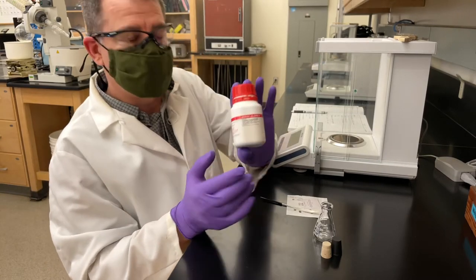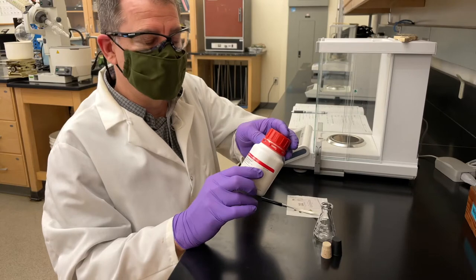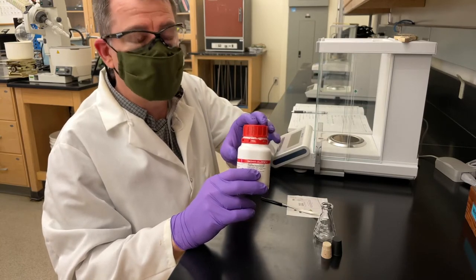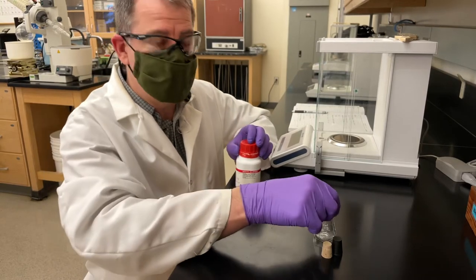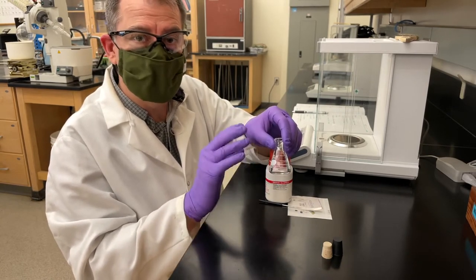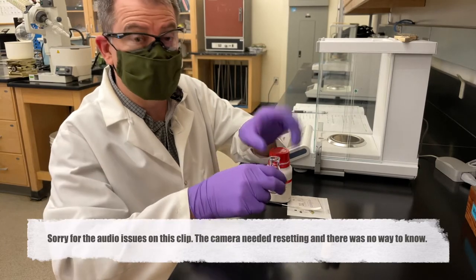We're over at the balance and we've got the thiamine hydrochloride. It's stored in the fridge — it's a sensitive product that degrades if it gets too hot. Thiamine hydrochloride is a coenzyme in vitamin B. We're going to weigh out 0.3 grams and throw it into an Erlenmeyer flask, which is our reaction vessel this time. This is just going to sit and do its thing over a couple of days — no stirring, nothing fancy.